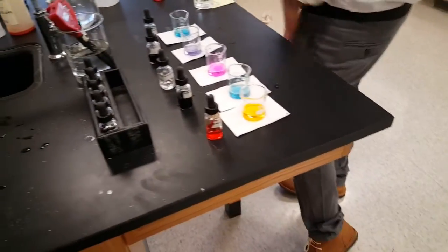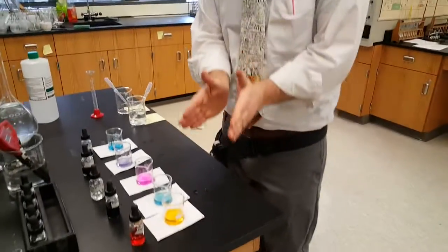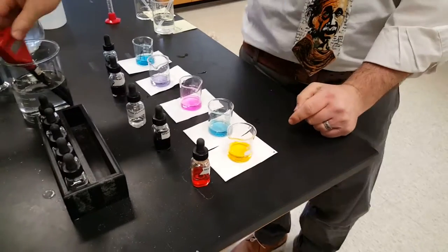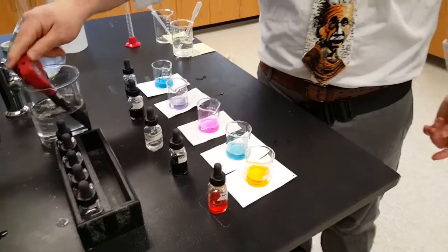and blasted past all those endpoints. That's not what I'm looking for. No, we wanted to go carefully, nice and neat, do what we did on the first one, and check that endpoint with the pH probe. I'm not putting this in there because I don't want you to see those. We blew way past all those, on purpose, to prove to you that they will change color.